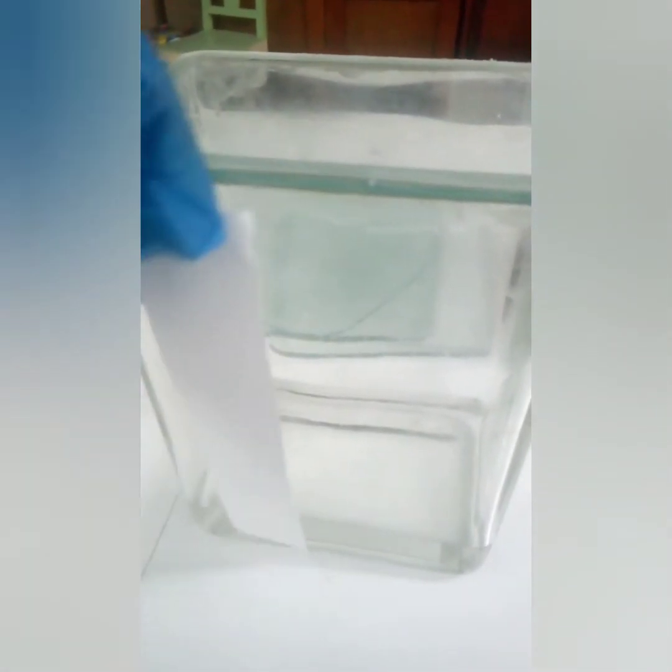While placing the paper inside, the bottom of the paper should touch the solvent, in order to allow the solvent to pass through this chromatography paper. The bottom of the paper should just touch the solvent, but it should not touch the glass jar, the walls of the jar. You should hang it on a thread. You can see here there is a thread.